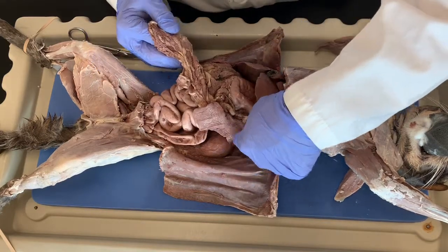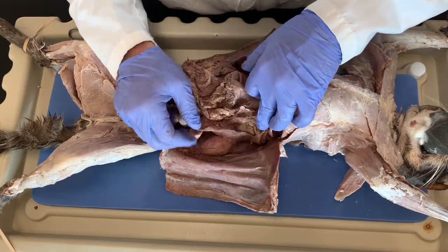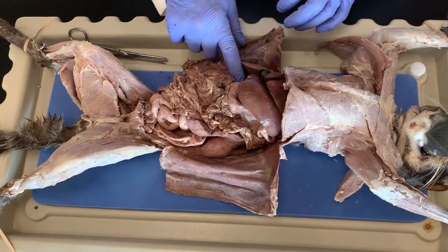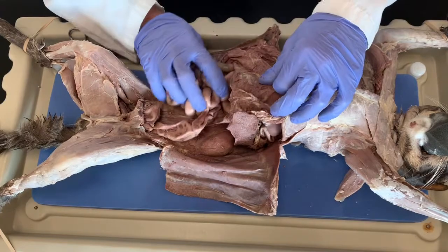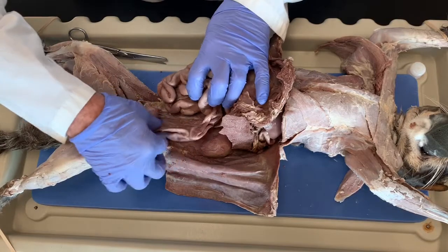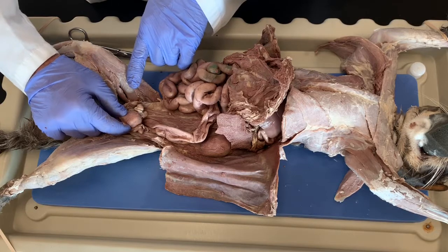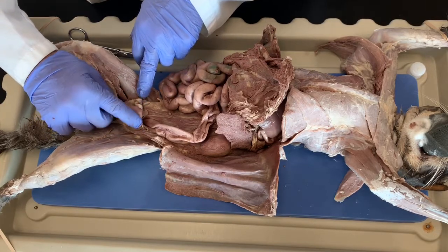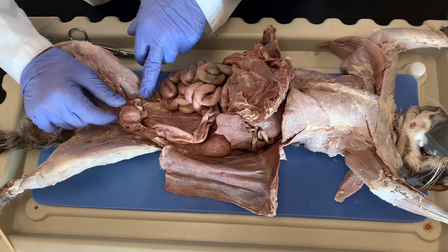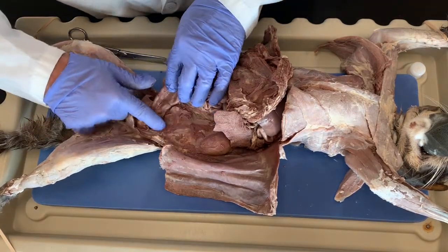Okay, so here is the spleen. We have the pancreas right in here. Okay, the pancreas is kind of like packed underneath the spleen, kind of partly in the first turn of the small intestine. And then this is all small intestine in here. And then this bigger tube is the large intestine, the descending colon that goes all the way down to the rectum. Okay, here we have the bladder, and then on the side of the bladder are these fat nodules, which contain the prostate glands. Okay, so this is a boy, and so there's no uterus here.